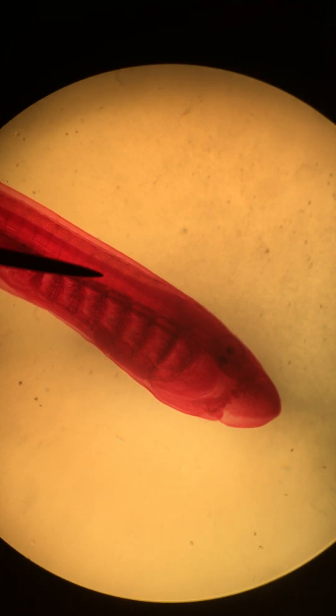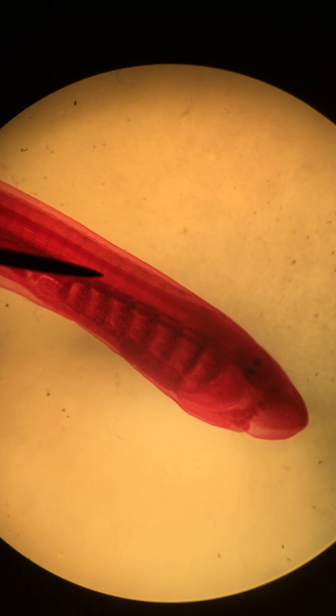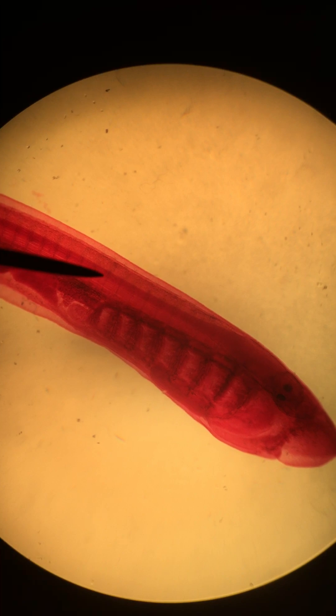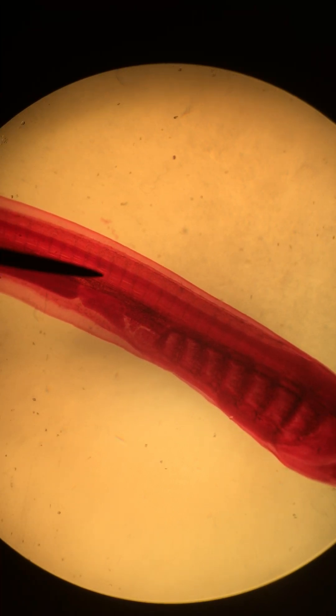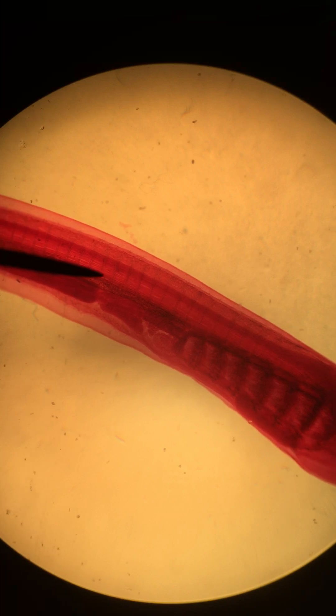And then just ventral to that is the notochord — just a little bit paler pigmentation, just ventral to the spinal cord. That's the notochord.